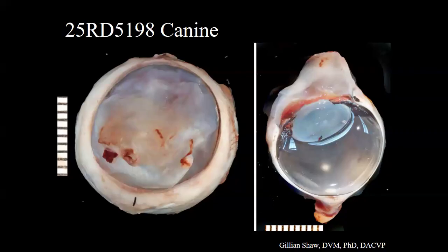And let's see here. They say ulcer slash perforation decompensated within hours into severe keratomalacia of the entire cornea. So here's the globe, and so they decided to enucleate. Here it is, front on view, which basically shows that there's opacity to the cornea, but it's much more dramatic when you hemisect it and look at how protruding that cornea is. It's also very thick, which is an indication of severe corneal edema. And when we see severe corneal edema like this, we call it hydrops. Corneal stromal edema.